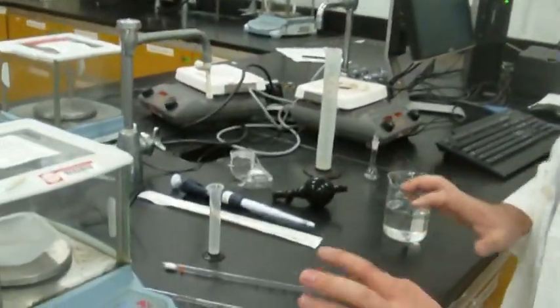All right. So now when you try to measure out a milliliter of water, how is this balance going to help you know whether you measured out that 1 milliliter of water? The density of pure water is well known. So if we measure out 1 milliliter and weigh it, if the mass matches up with the density, we can say that we have 1 milliliter of water. Okay, excellent. So let's see it happen.